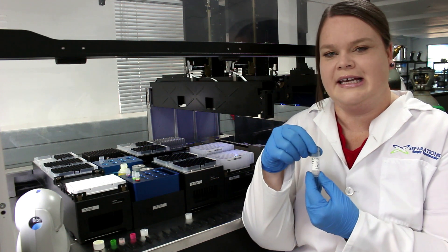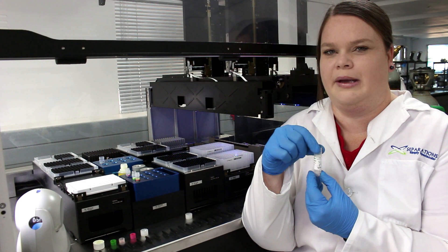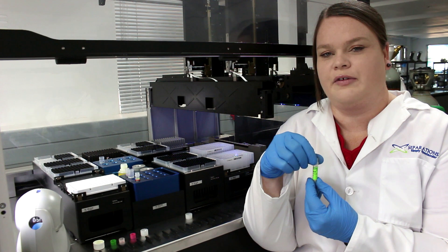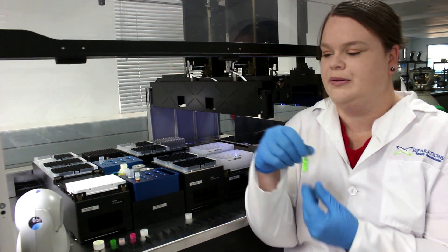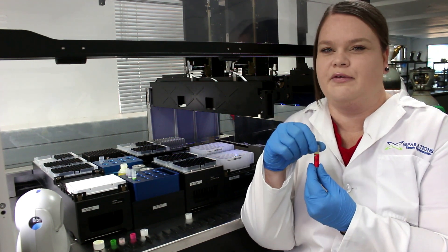Reagent C includes all the ingredients needed to get the PCR going and keep it going. We then also need both a negative and positive control, which is specific for each pathogen.